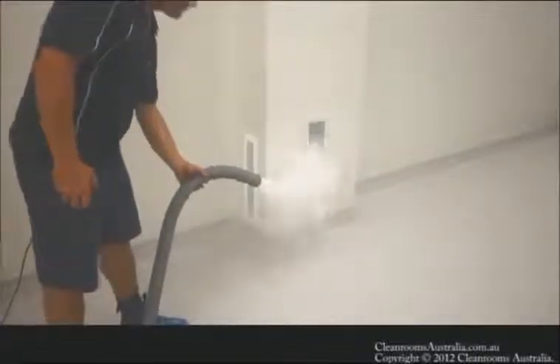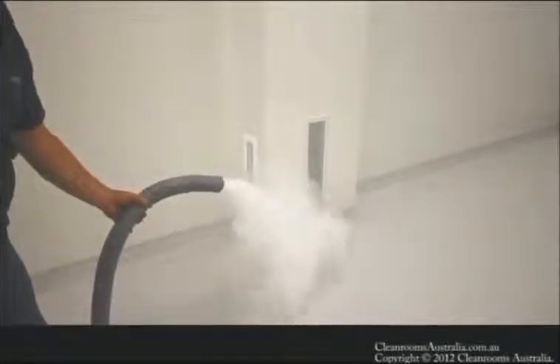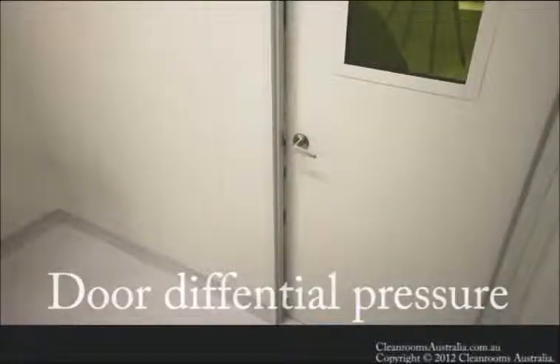The idea is that you wait for the recovery of the room, and once the room is recovered you then take the shot. It's also very important to use a smoke with a large enough particle size to get caught in the primary filters, so as not to affect the secondary or HEPA filters with the density of smoke in the filter itself. The density of the smoke is very important, as you can see here — with a high airflow across a boundary, it's somewhat harder to see the flow of air.